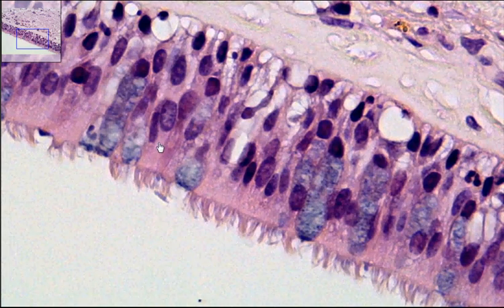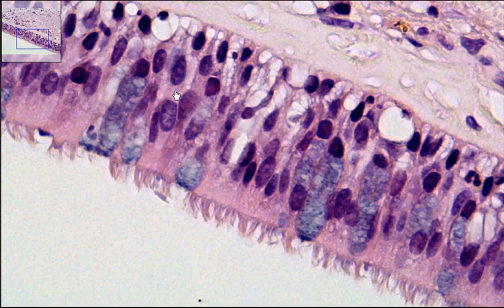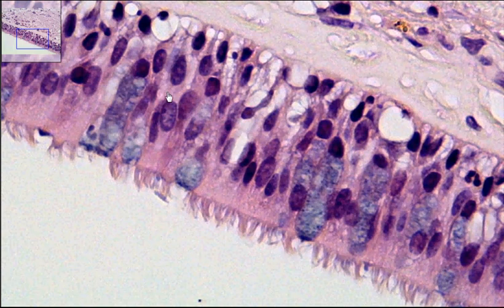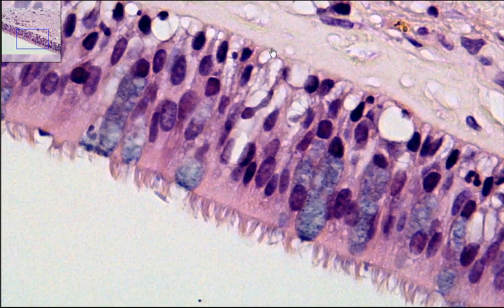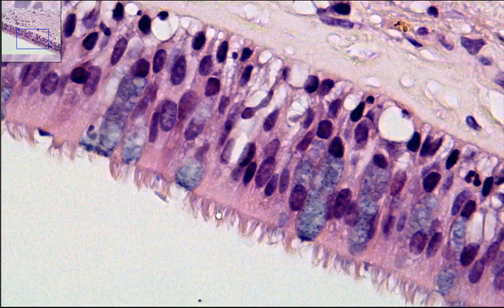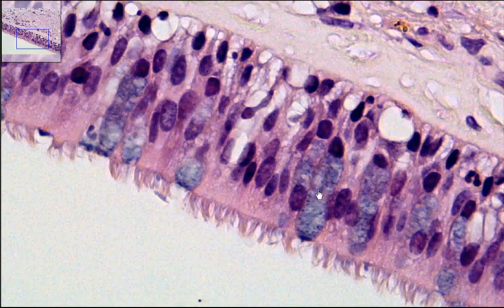You can notice how the nuclei are at various different levels. That's because the term pseudo means false, and stratified means layers — so these are false layers. They look like many layers, even though they're only one single layer. Every one of the cells will touch the basal surface down here, right where the cursor is. Not every cell will reach the apical surface. So we have our ciliated pseudostratified columnar epithelium with goblet cells.